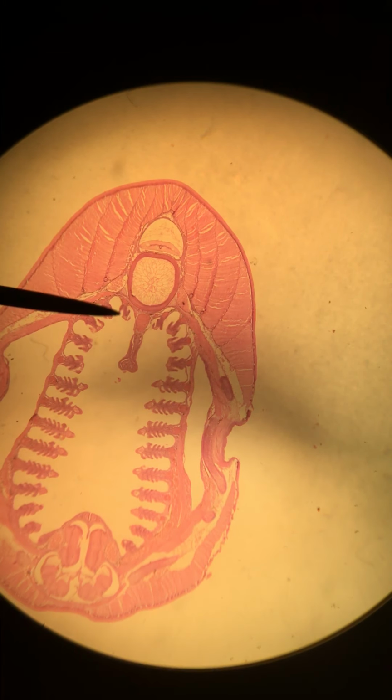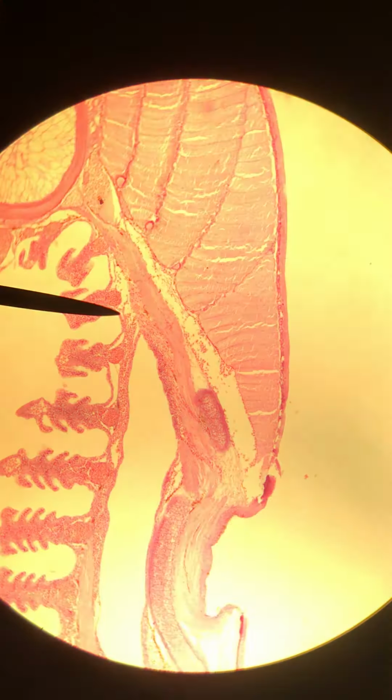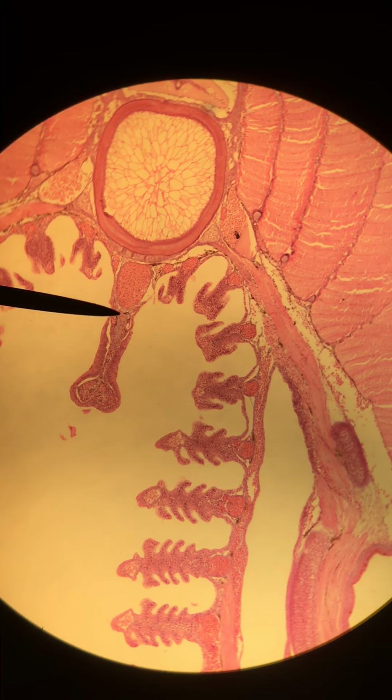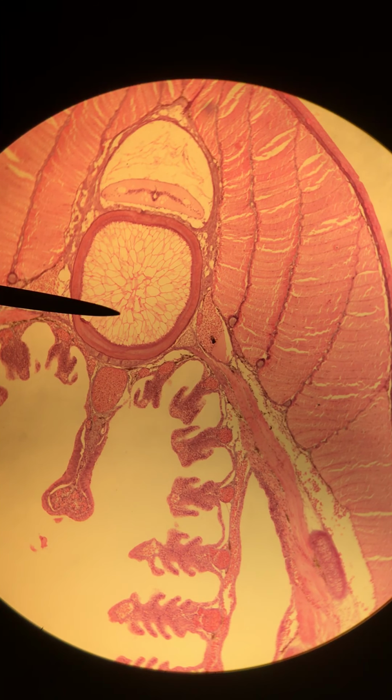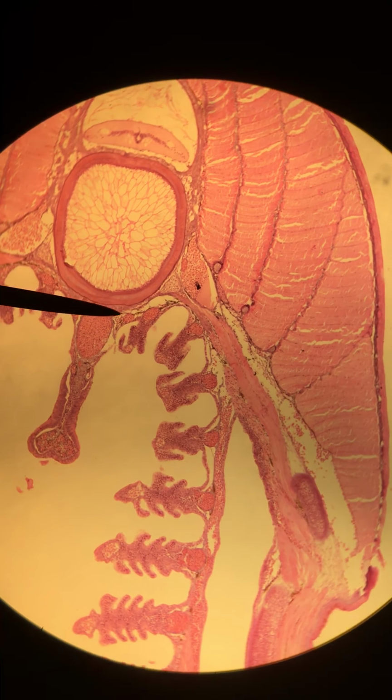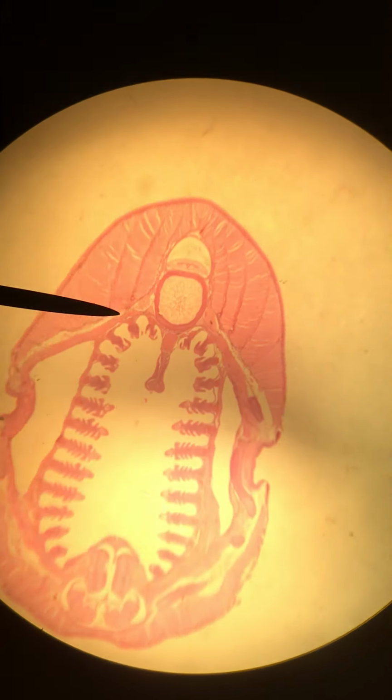And then we want you to know a few of the blood vessels. We aren't asking you to be responsible for all of them, but one of them is the dorsal aorta, and that is right here. I'm going to zoom in a little bit to show you that in more detail. It is right here on the midline, just ventral to the notochord. That is the dorsal aorta. I think that is it for this section.